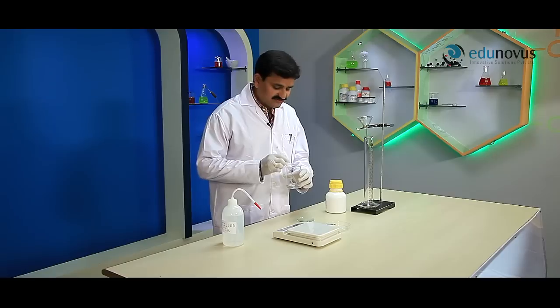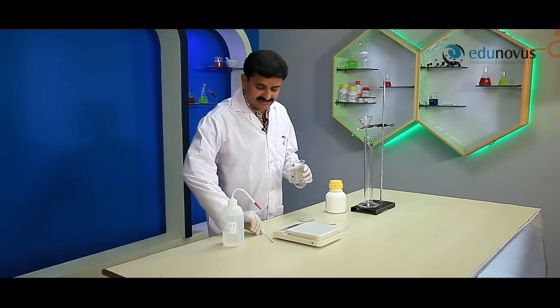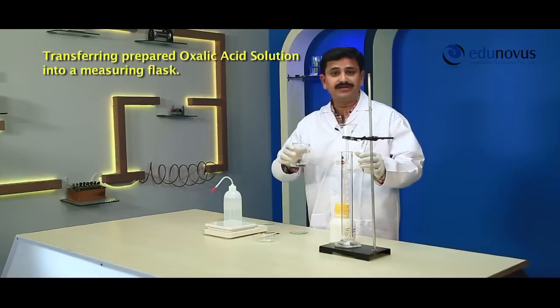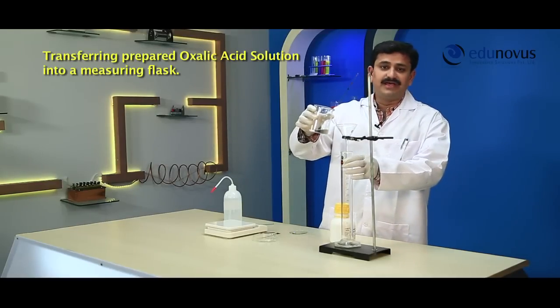Now let us transfer this solution of oxalic acid into the 250 ml measuring flask with the help of a funnel.